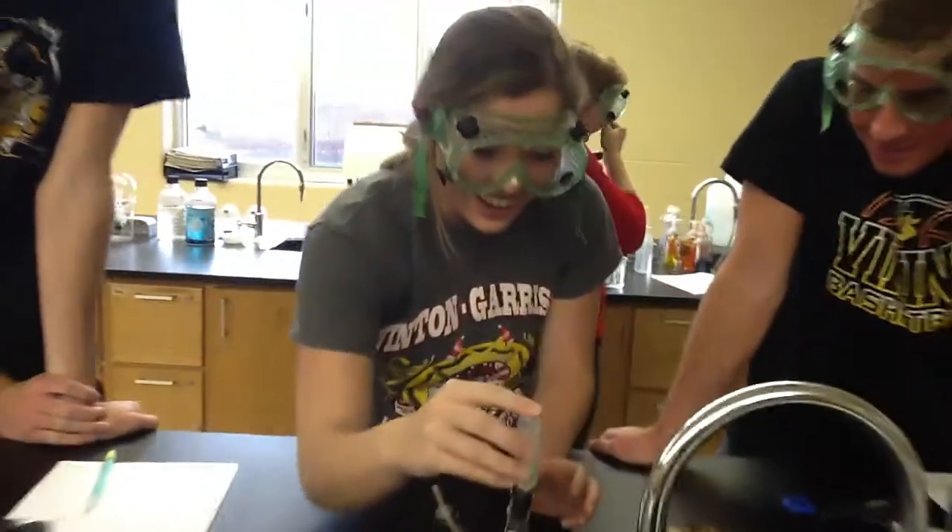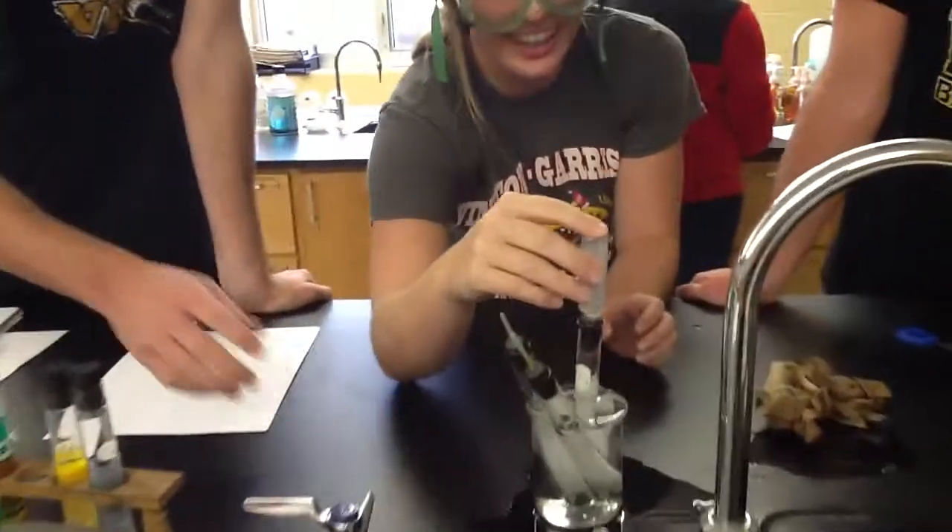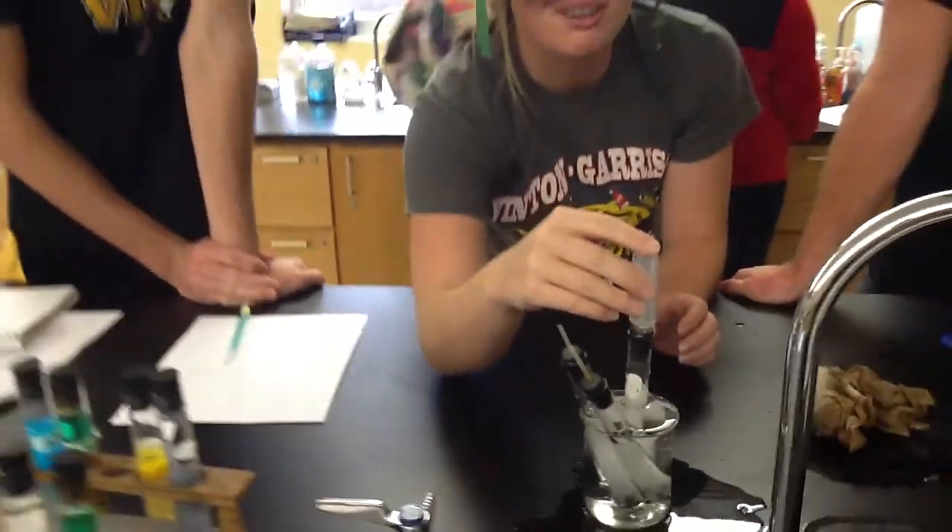You're spilling! This is hydrochloric acid — it's quite dangerous.